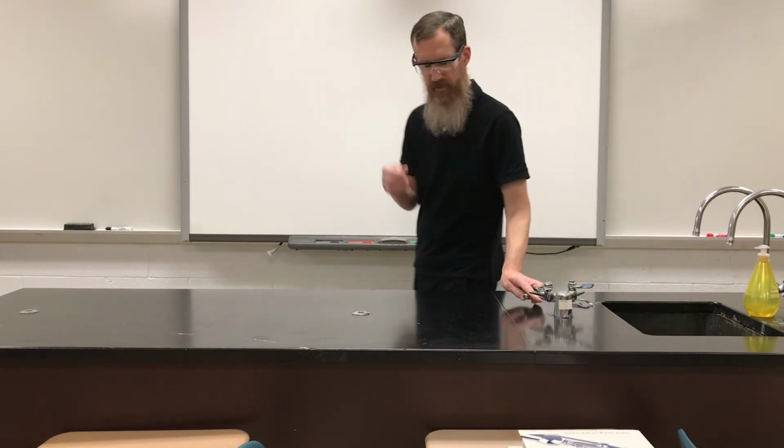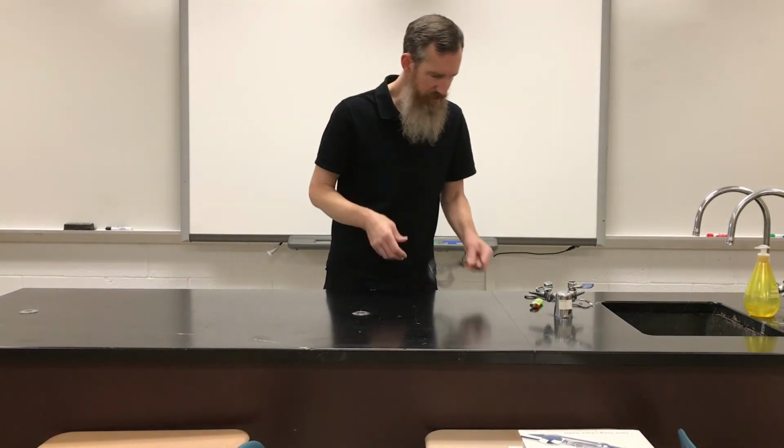So, again, on the little data sheet, you're going to see this representation of this reaction in words. What we're going to do is translate it into symbols. We're going to talk about how we observe the reactants and the products in terms of their physical state and their color and other nature.